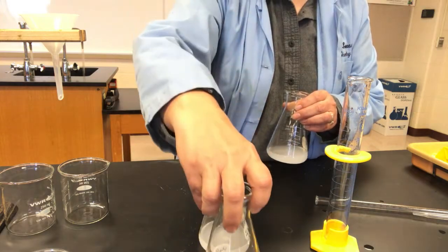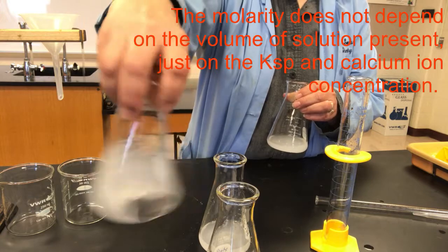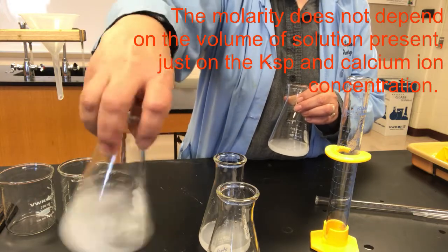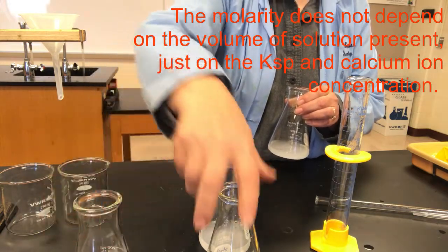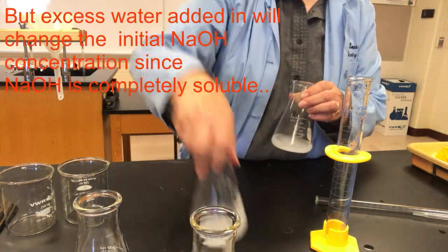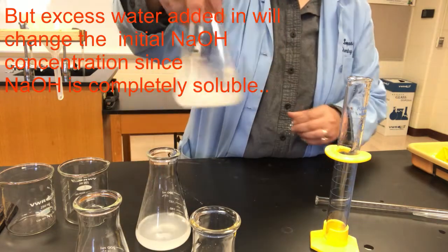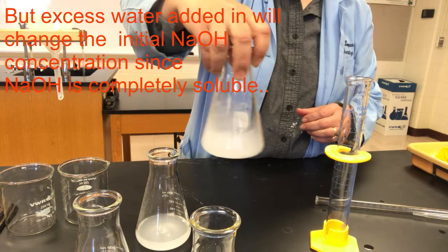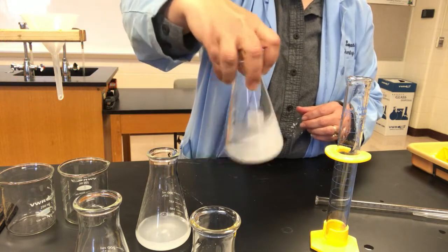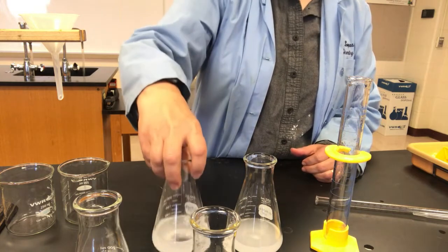We're not going to try and shake them until they're not cloudy anymore. When we're satisfied that we've been aggressive enough with the dissolving process, we're going to filter out the excess solid remaining, leaving just dissolved calcium hydroxide in the solution with the previous dissolved hydroxide.